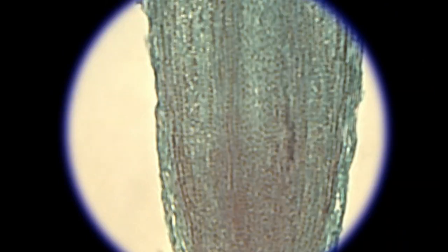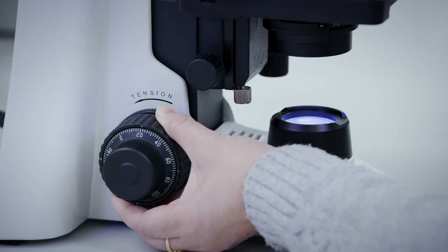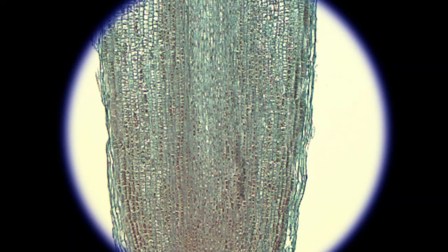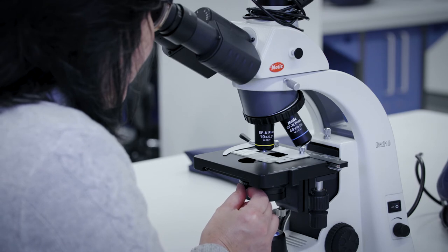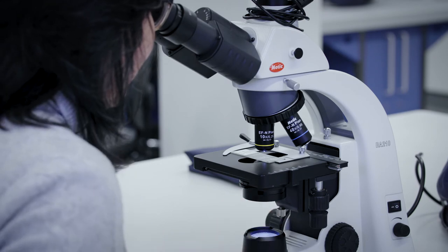Increase the magnification by using the 10x objective. Focus the image first with the coarse focus knob and then with the fine focus knob. You may have to open the condenser iris diaphragm to allow more light in for a good image.